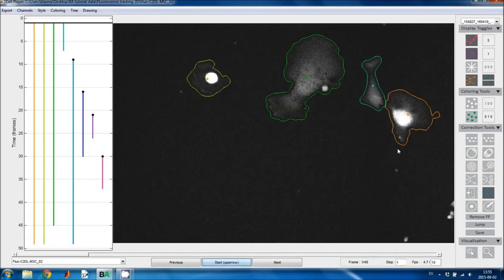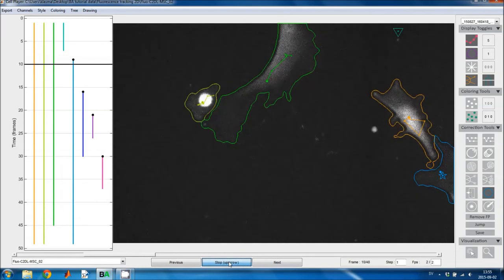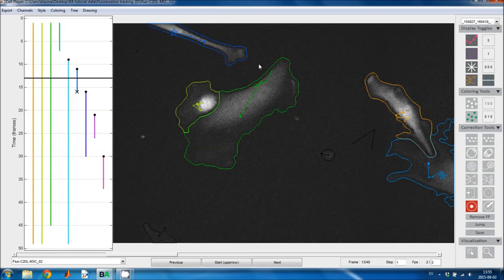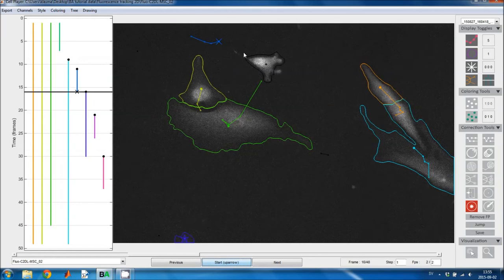We'll start in the first image. This looks fine. We can lower the frame rate and watch the sequence. Now we have something here which should have been classified as a cell, but it wasn't. So I'll use the undelete tool to get it back. And here the cell moved too far for the algorithm to catch it. So we need to introduce this link using the track linking tool.